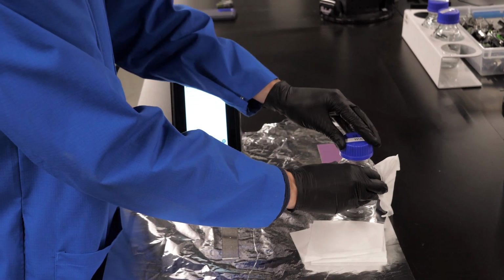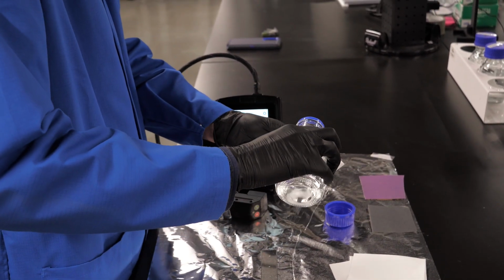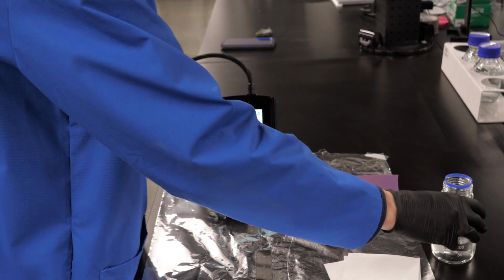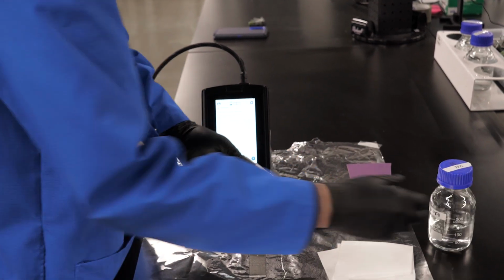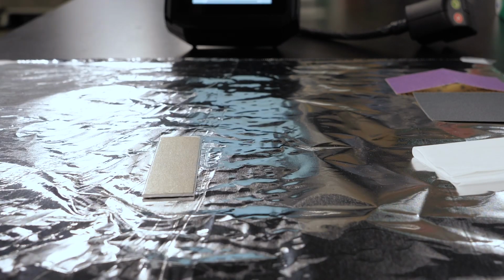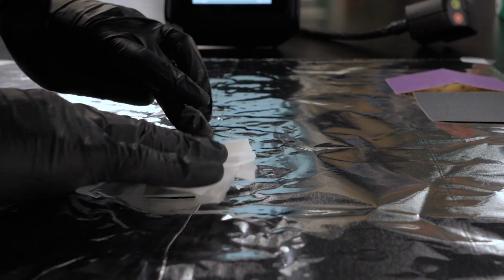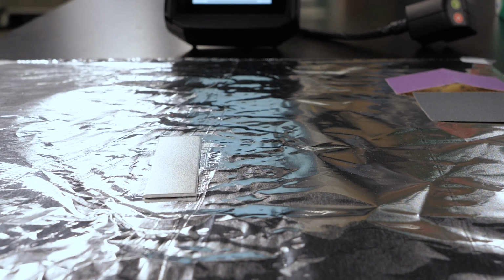In order to remediate these surface contaminants, we're going to clean the surface with a simple isopropyl alcohol wipe. I'm going to start by applying my alcohol to the wiper and do 4 unidirectional wipes across the surface of the aluminum coupon. I'm taking care not to reuse the same surface of the wiper twice and to not trace my path with that same wiper. I then follow it up with a dry wipe to remove any partially dissolved contaminants in the remaining solvent.